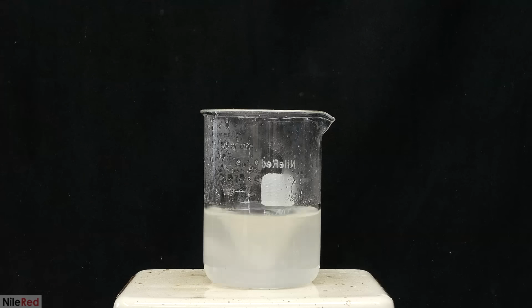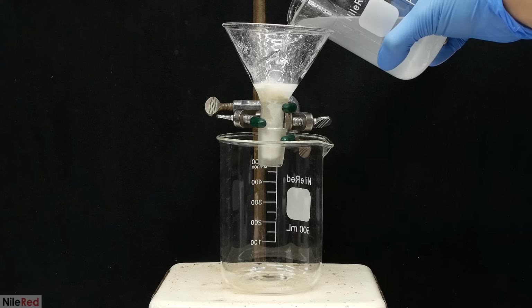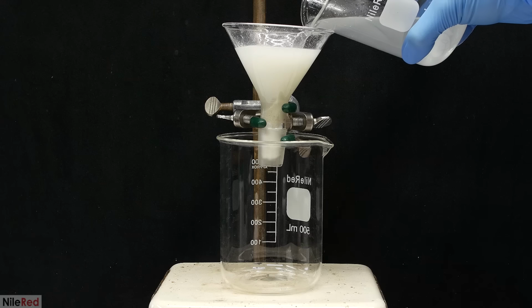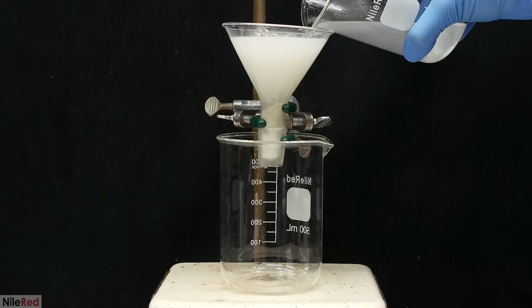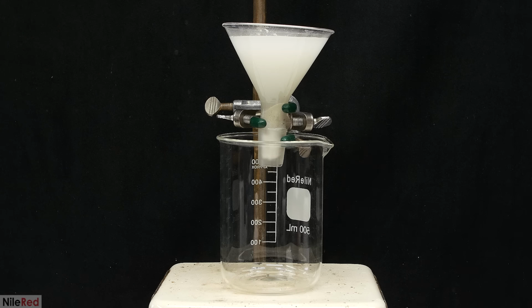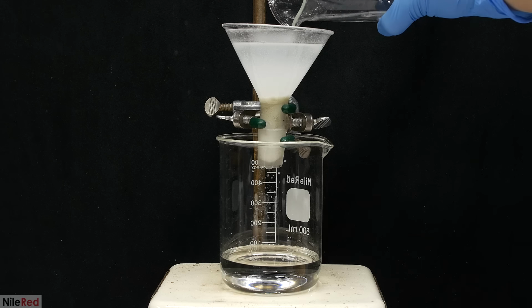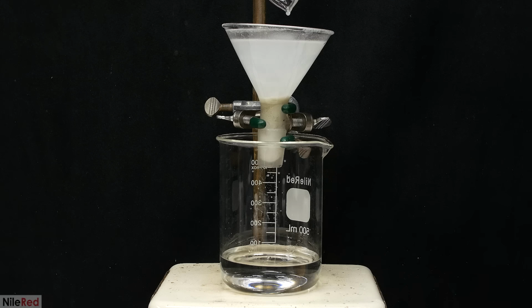All of the adipic acid should be in the form of sodium adipate, and the cloudiness here is due to impurities. The impurities that are present seem to be very small particles, which tend to easily pass through filter paper. So to get rid of them, I have to instead filter it through something called Celite, which is very similar to extremely fine sand. The solution passes through relatively slowly, but the stuff that I collect is crystal clear.